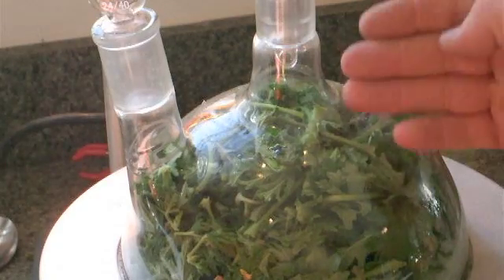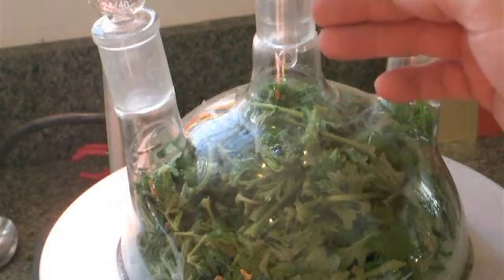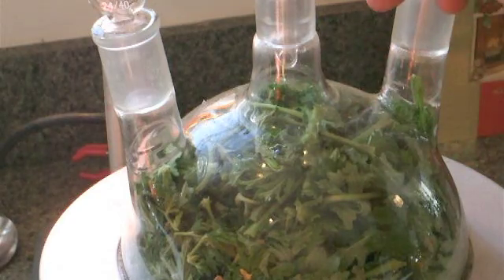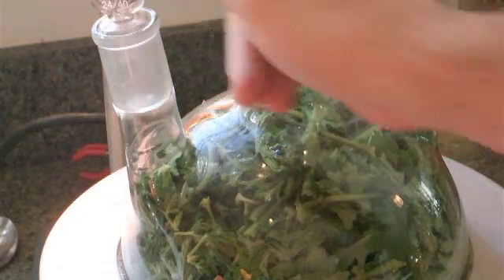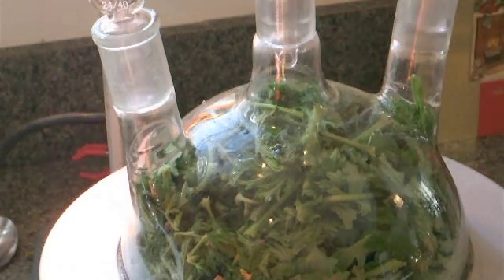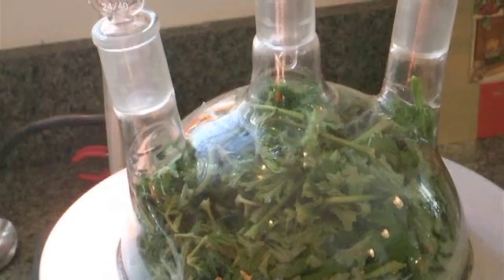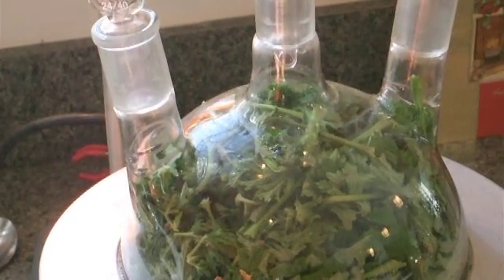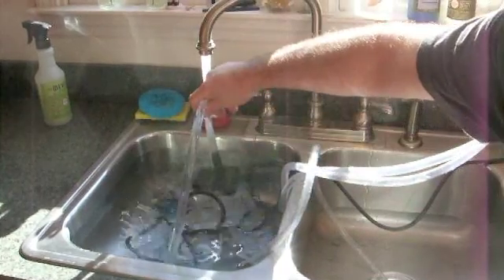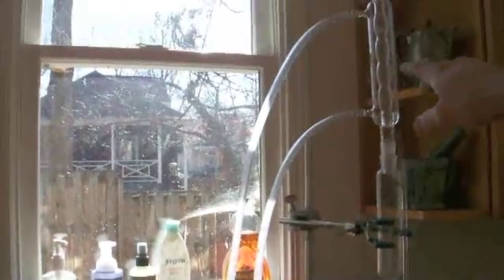As you can see, the plant matter vapors and the steam are going to have to go up here and through this tube, so it's really important that we don't get this blocked. These joints would just pop out to relieve the pressure. I like to wet the glass joints as I put them together — that helps show that they're sealed. There's a little fountain pump in the end here which I'm going to pump through and use to cool the condenser.